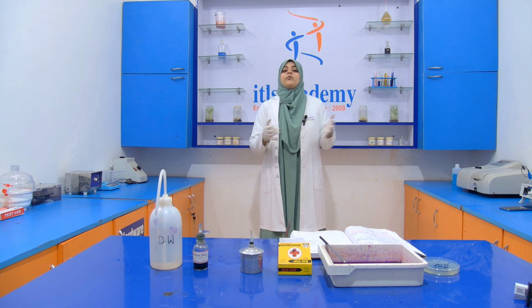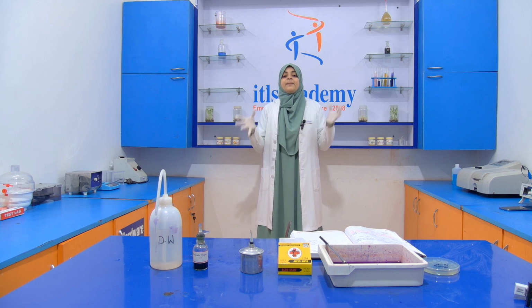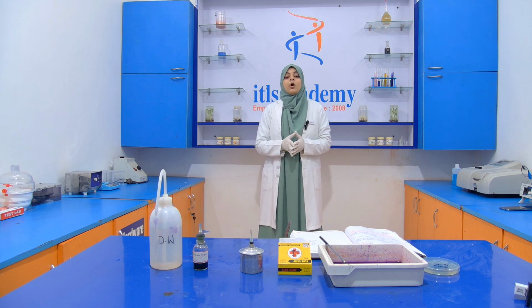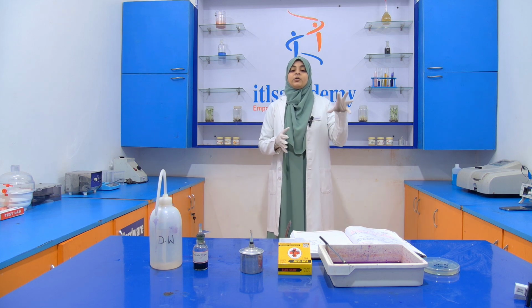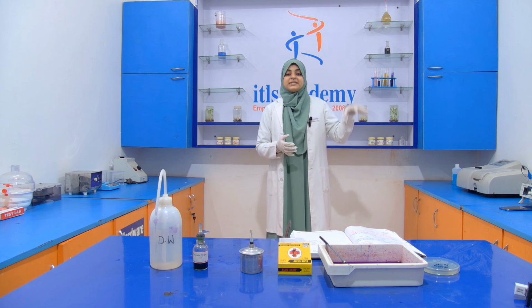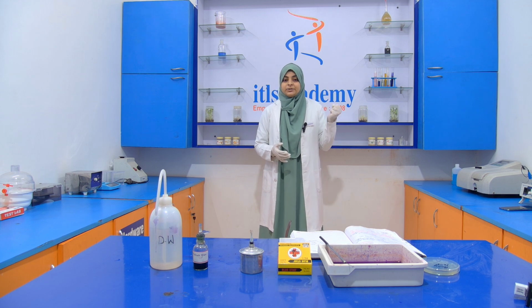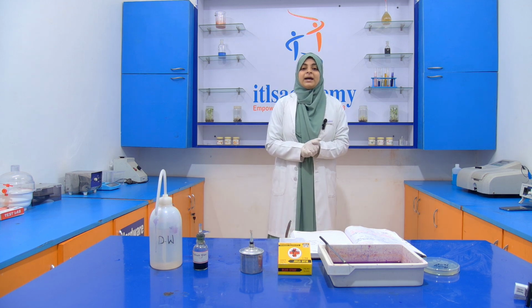That's why we use staining. These stains color the microorganism or highlight a particular area, so when we see that image inside the microscope, the image has contrast. This is called staining.